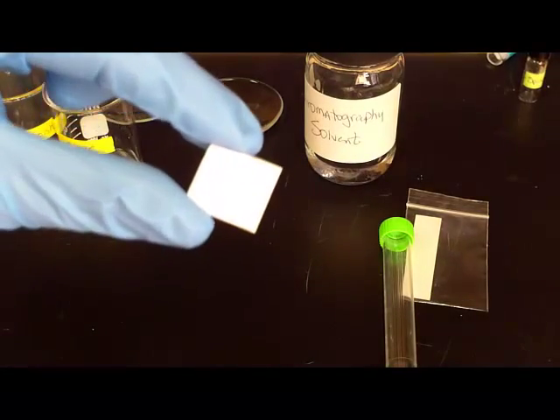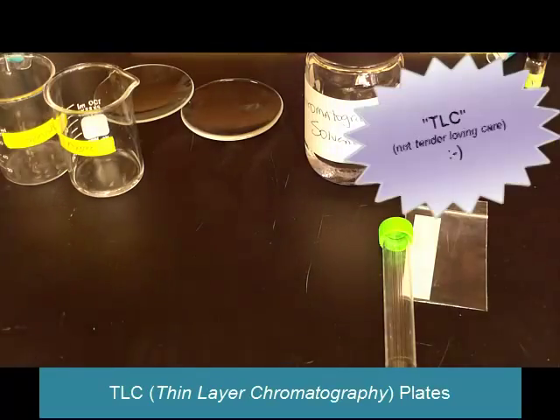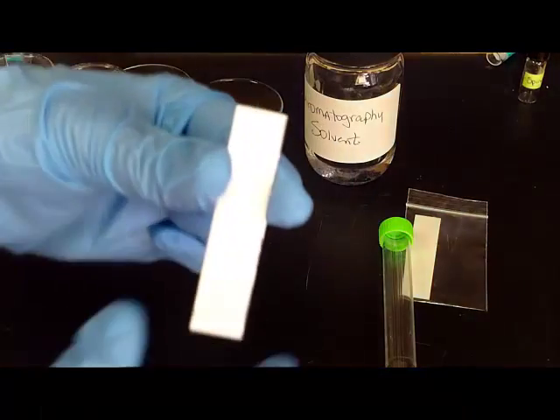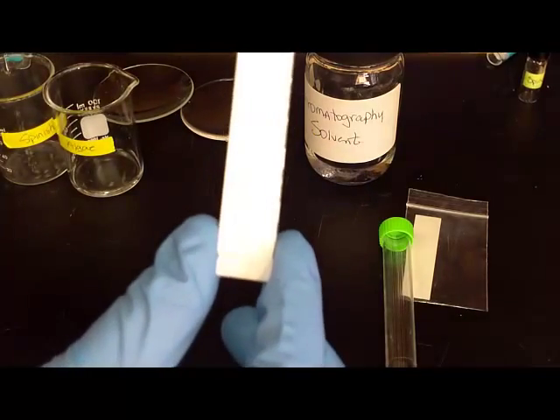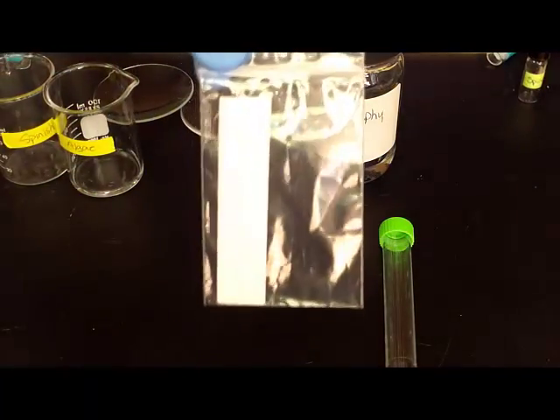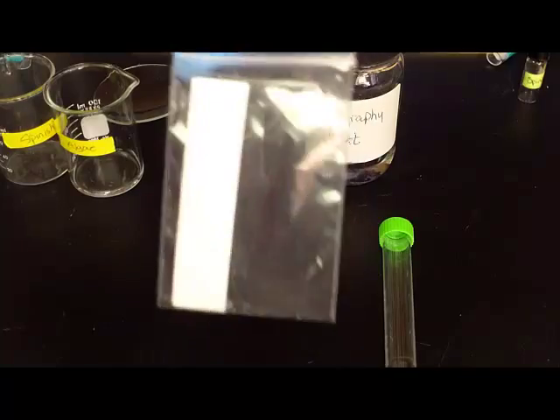This is TLC thin layer chromatography plates, but when you actually run your test there will be long strips like this. The way I'm giving those to you is in a small ziploc bag and this is how you will turn it in. So each group will have two of these.